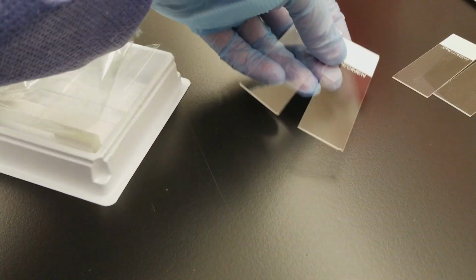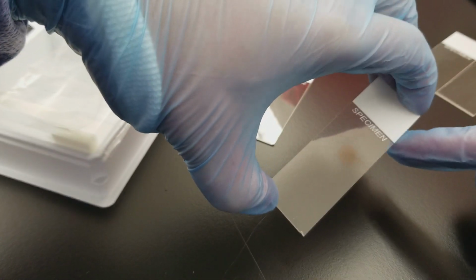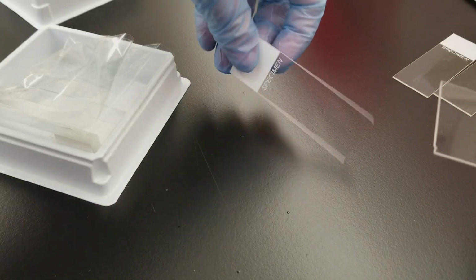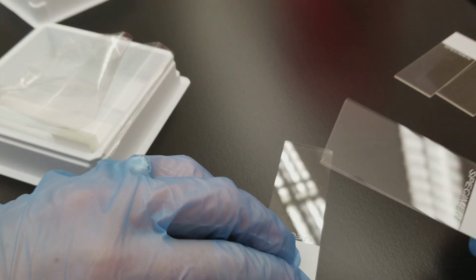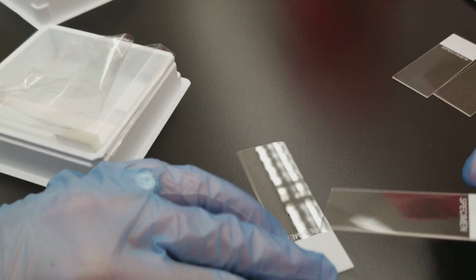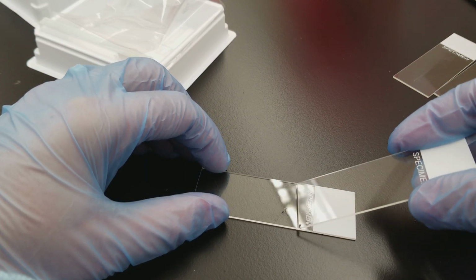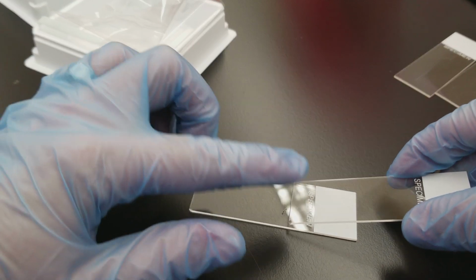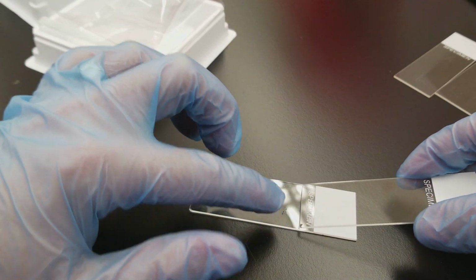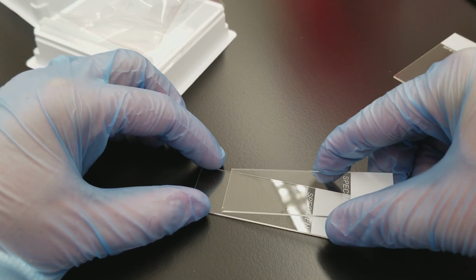So we're doing a different technique today, and we're actually going to be using the side of the slide. This is intriguing. It was intriguing to me too. I saw this person doing it, and I thought, hey, that's a really cool idea, because in the normal way to make a smear, you have to regulate the level of incline that you have on the spreader slide against the flat slide that has the specimen being spread on it.